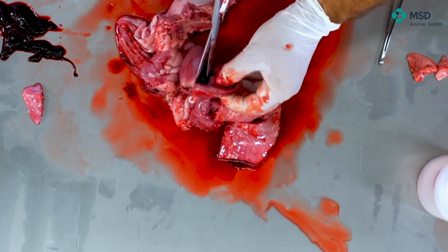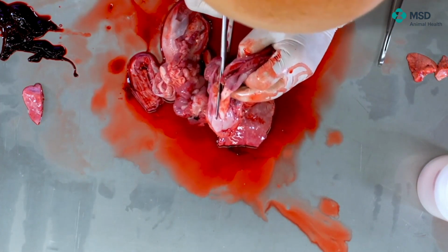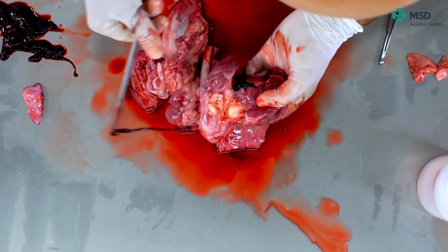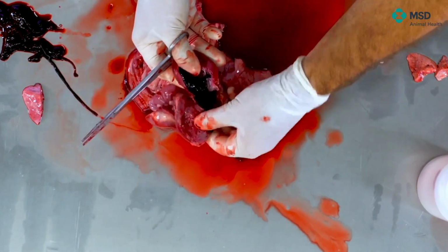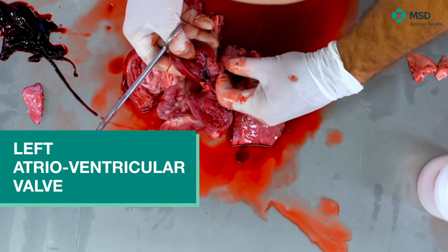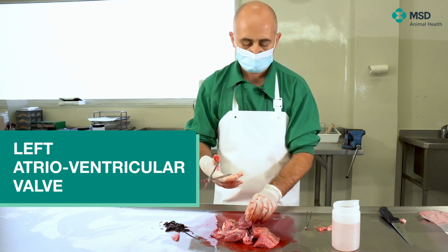In fact, look at the scissors in here. I'm cutting, I'm going out through the aorta. So here we see the aorta, we see the valves, and we can see as well the clots that we can remove, and we will observe the atrioventricular valve. In general terms, this looks normal, so it's not a problem.